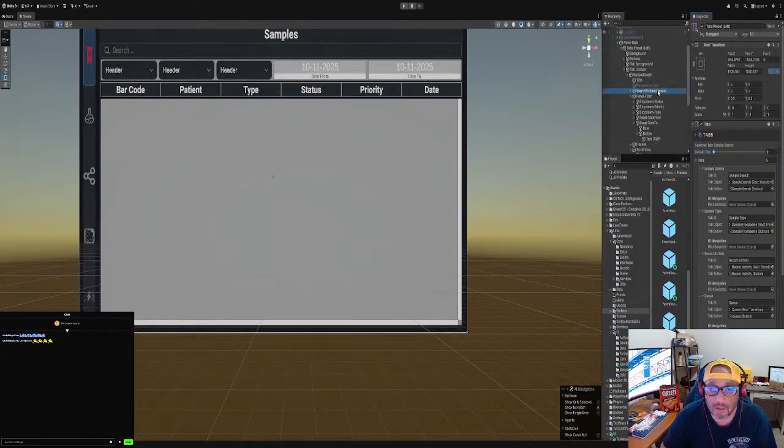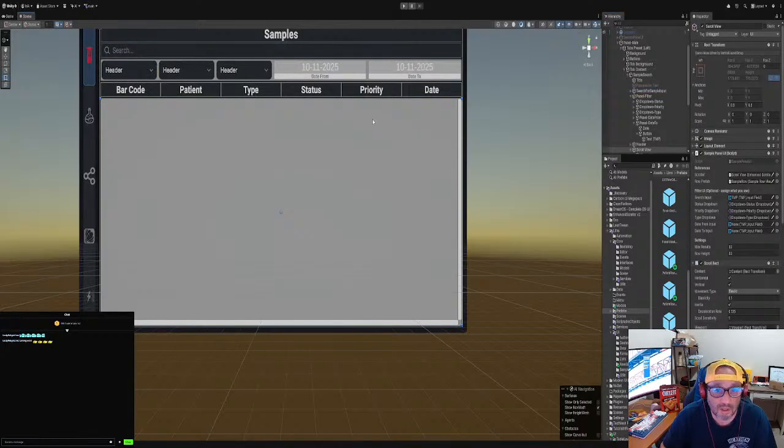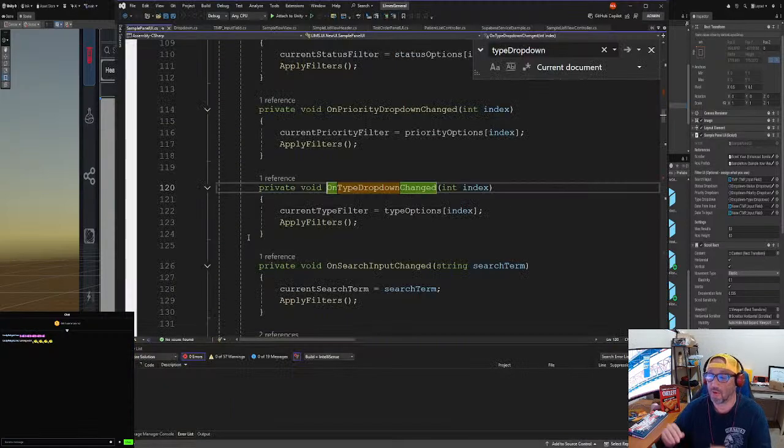All right, and so we have our search sample input. That was done. So here, scroll view, right? Okay, let's open up this script and talk about it before we move on to the next issue, which is just going to be me freestyling it and building out the UI.